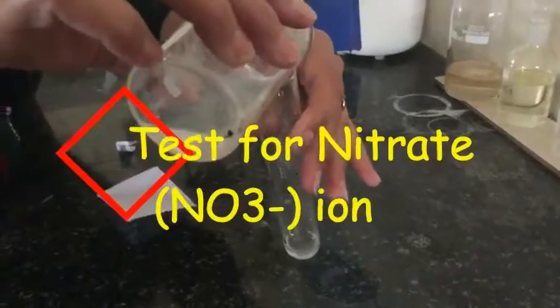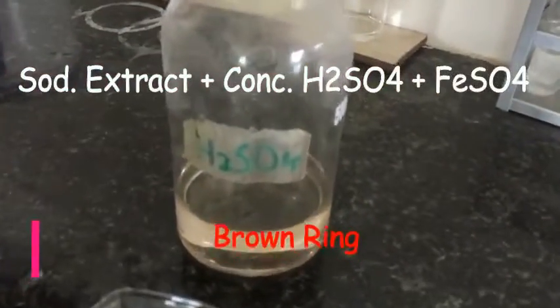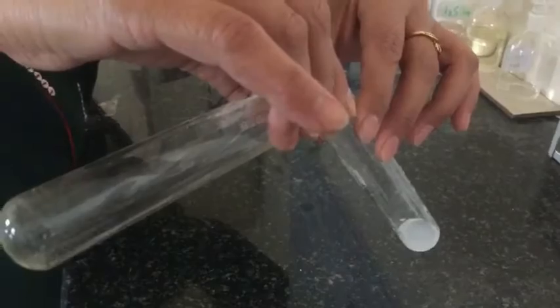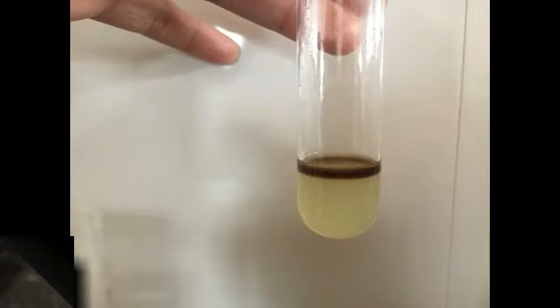Test for nitrate ions. I have taken the sodium carbonate extract and to this I have added concentrated H₂SO₄, and then freshly prepared FeSO₄ (ferrous sulfate) solution. At the junction you can see a brown ring is formed. This is the confirmatory test for nitrate ions.